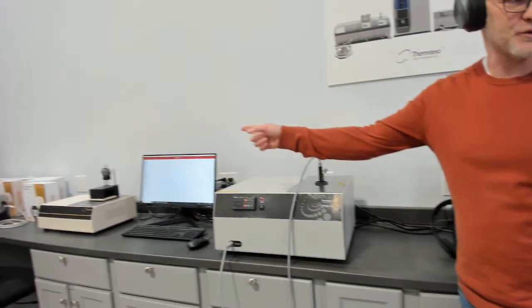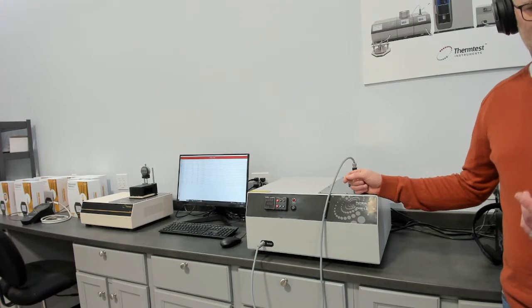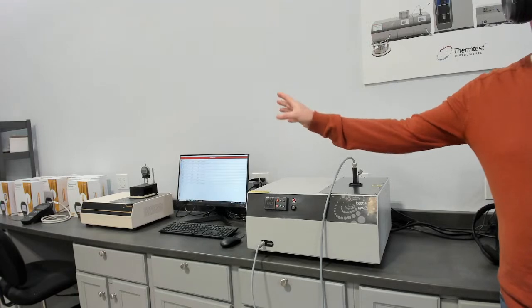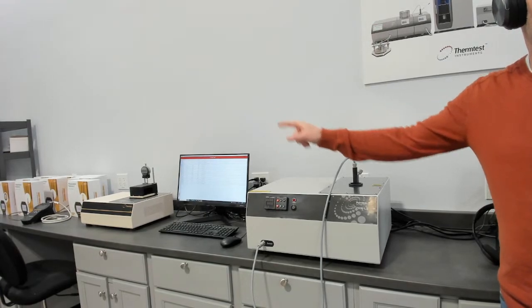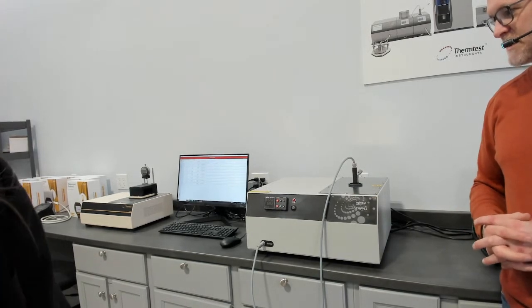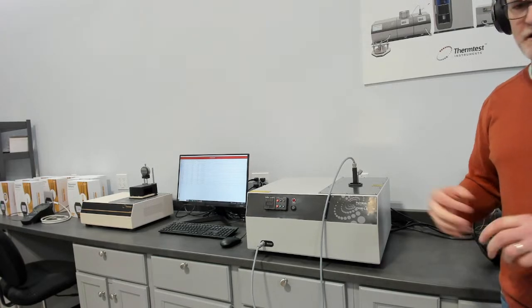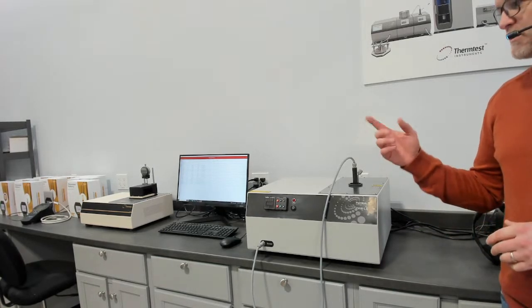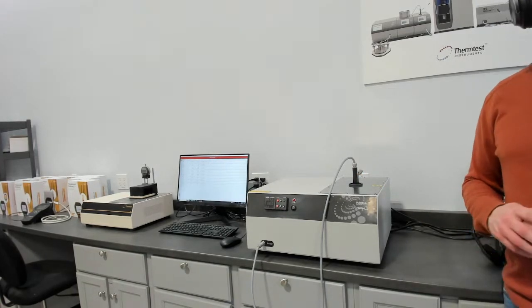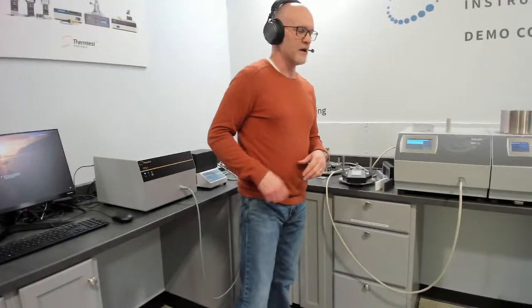And down the end of the table, we have our small format heat flow meter. It's for measuring small-sized insulation. And then the baby brother to the MP-1 is down the rest of the way. That is our MP-2, which has primary sensors, transient plane source, transient hot wire, transient line source, in an affordable package, but it gives you the ability to make good measurements on primary sensors. We really do try to create a situation where people are using the right method.